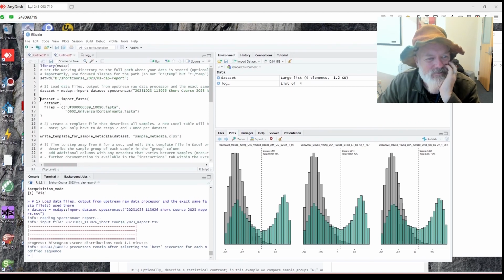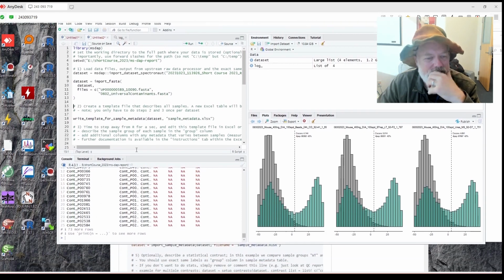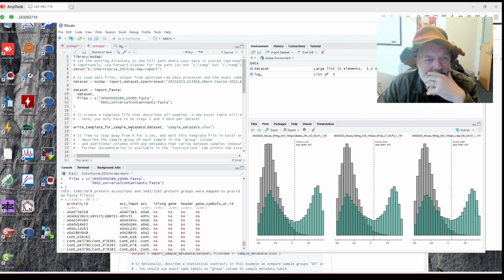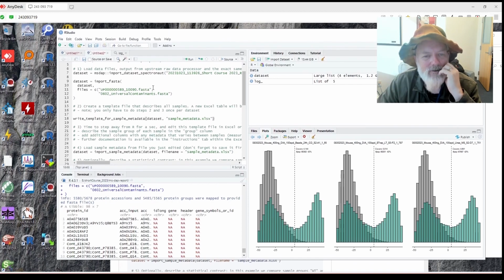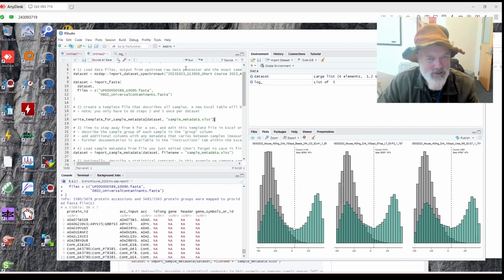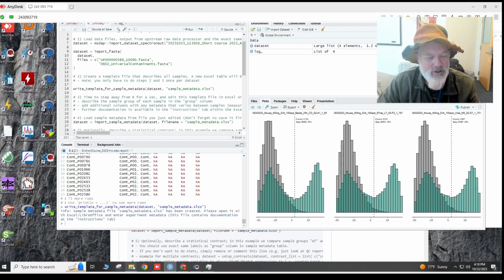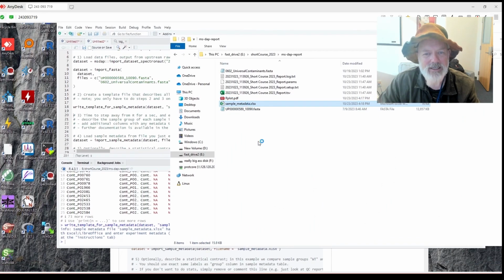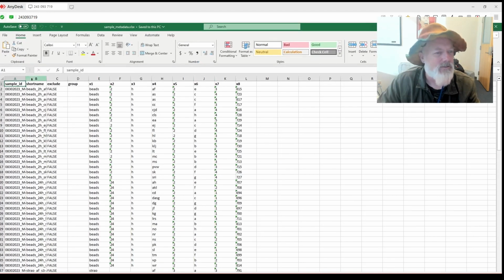All right, so now let's import our FASTA. So we're going to do this again. Boom, it read both of our FASTA files. It has some stuff on the screen. We can just ignore all that, I think. And then it will write this. Now this is super useful. It'll write a template. So this confused me for a minute, but now you write a template. Now where your working directory is, you will see something called sample metadata. This is super cool. And so you open that in Excel and basically you edit it.